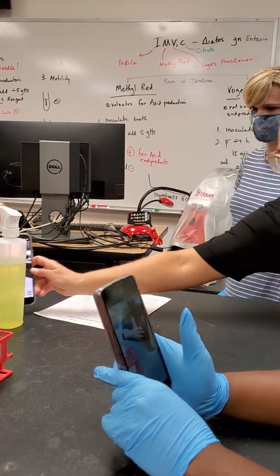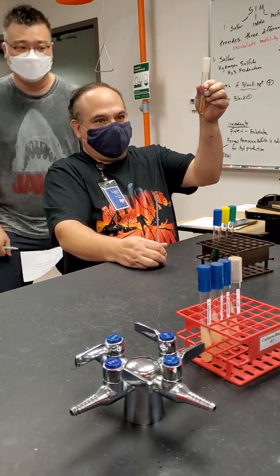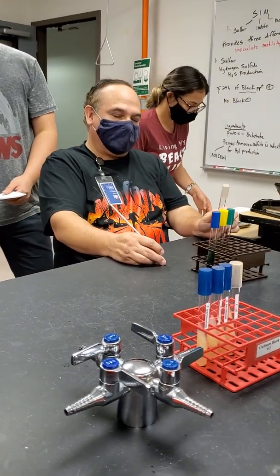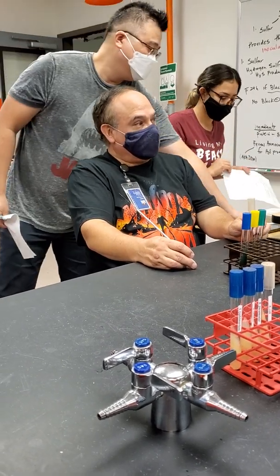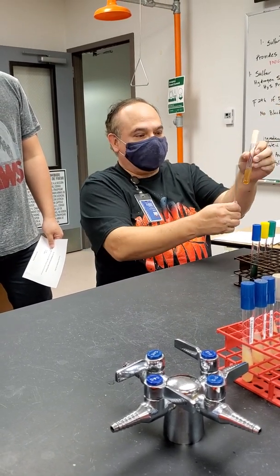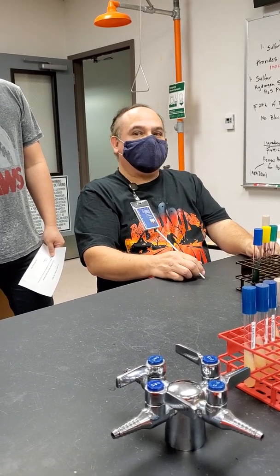Let's talk about the SIM first. The SIM is what has the test for indole in it, but you can also test for 2 other things. We got smart after a while. We just stopped doing indole tests by themselves and started doing all these 3 tests because you could get 3 pieces of information from 1 test. This is a motility medium. So how are you going to inoculate it? With a straight needle.